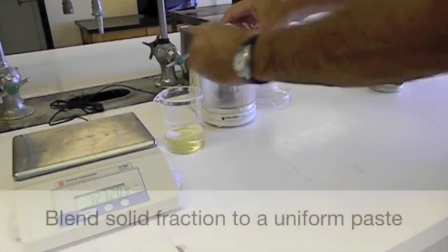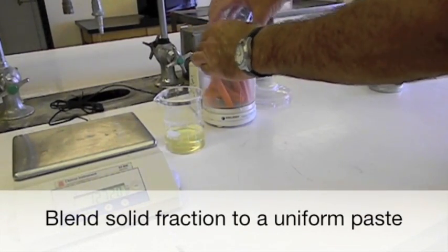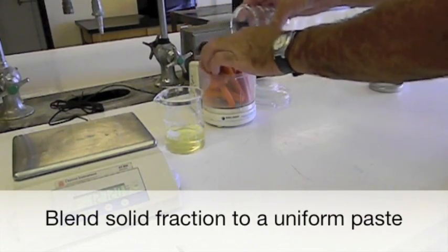Blend the solid fraction to a uniform paste. If needed, 20% distilled water may be added to achieve paste consistency.